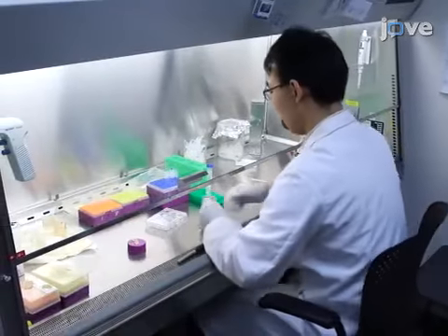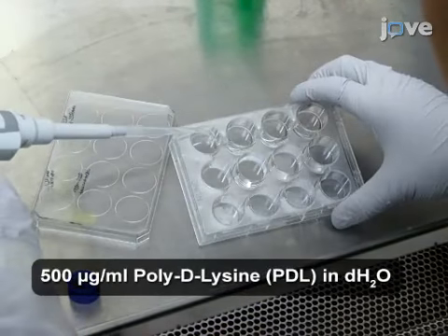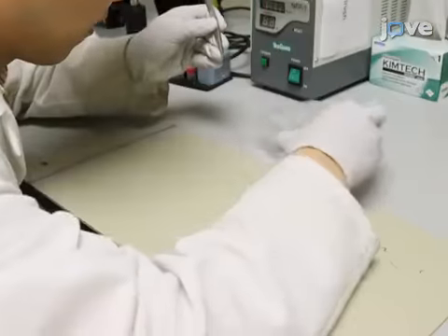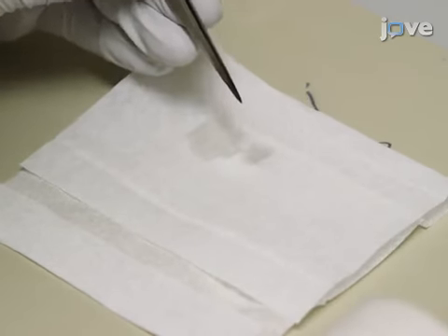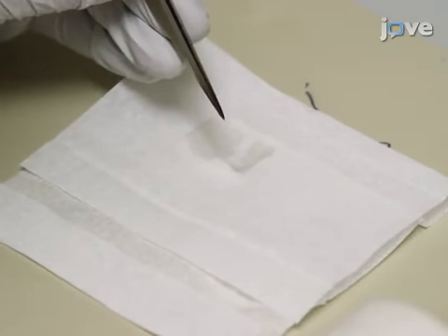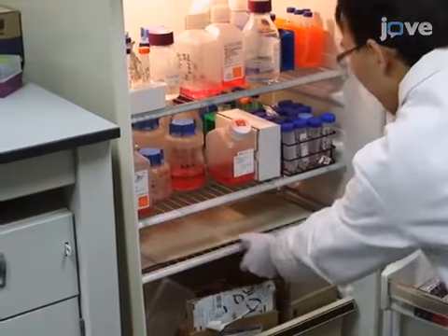On the day of the experiment, coat cover slips with 1/2 to 1 milliliter of PDL. 1 or 2 hours later, absorb the excess PDL with tissue paper from the edge of the cover slip. Then, store the cover slips on a metal plate at 4 degrees Celsius.